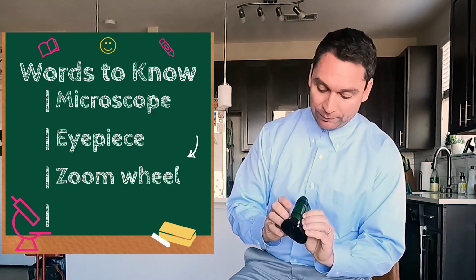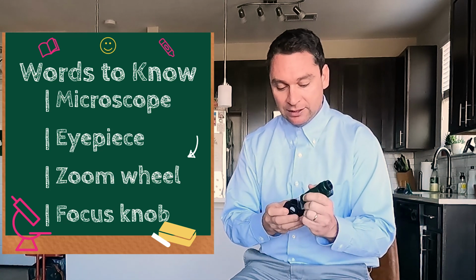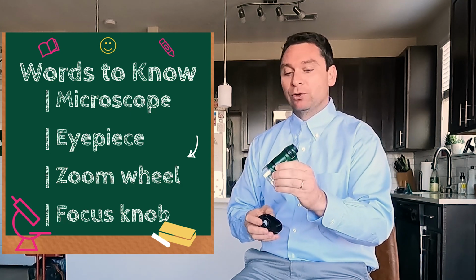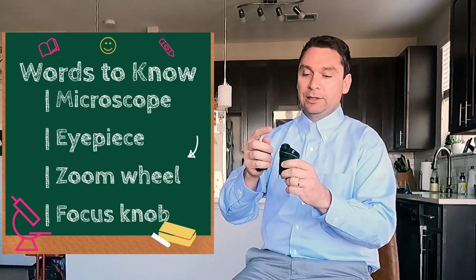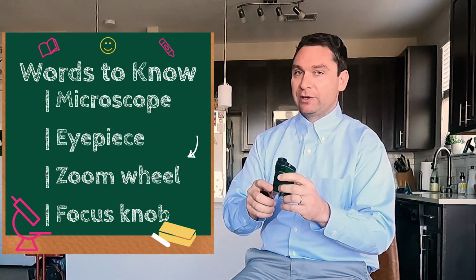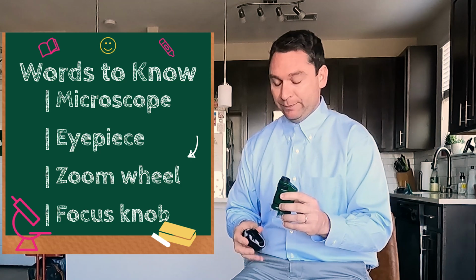Below our microscope, we have our focus knob. This little knob right here allows us to focus in on the object that we're looking at. Microscope, eyepiece, zoom wheel, focus knob. Those are our 4 words that we're going to be talking about today.